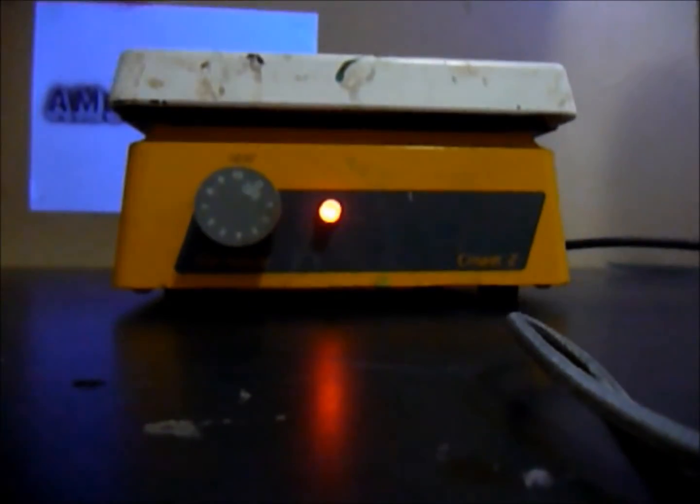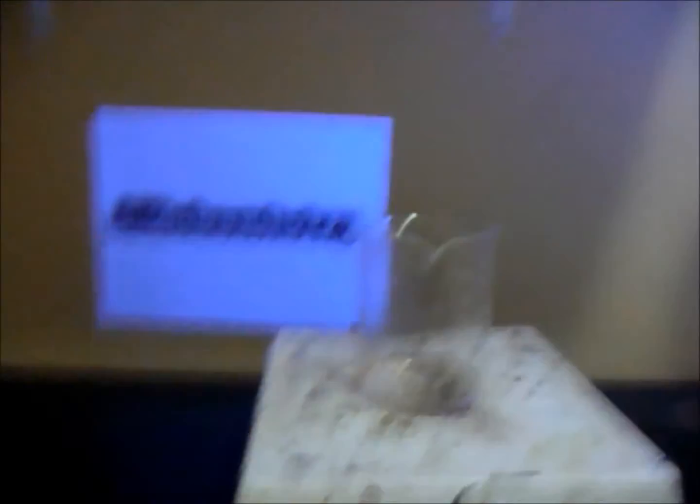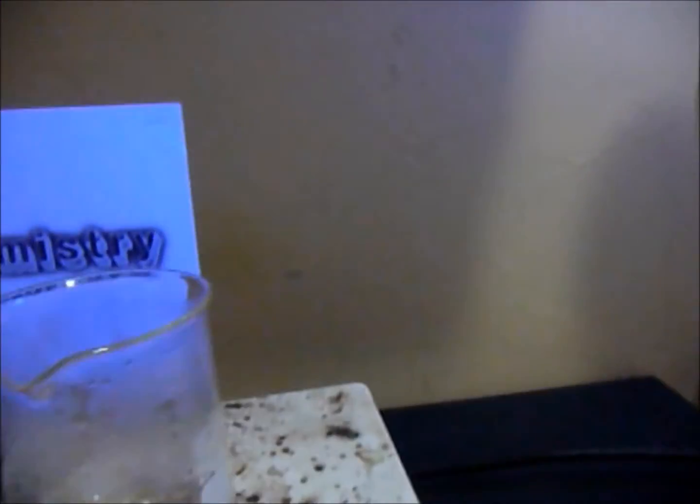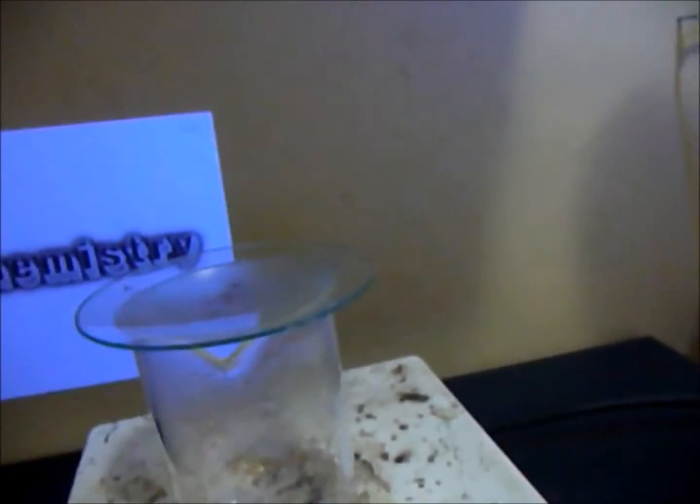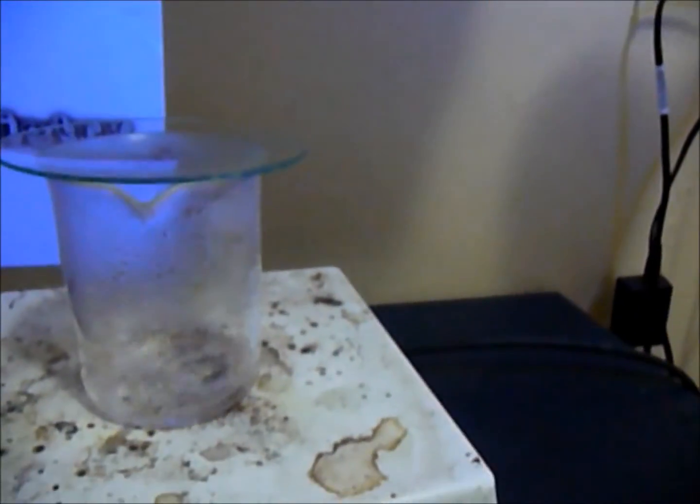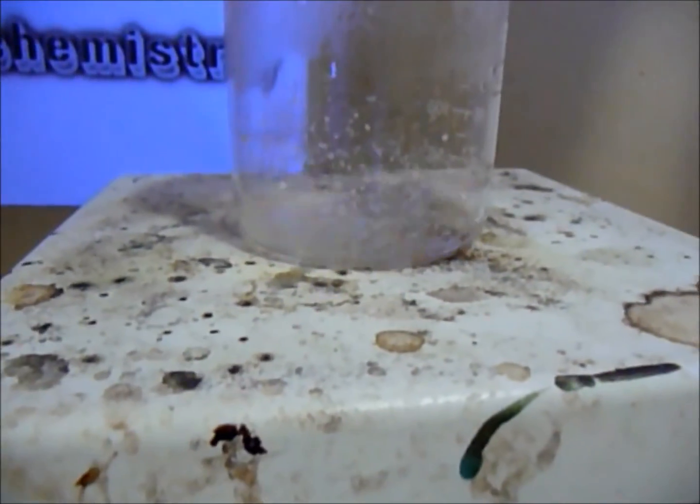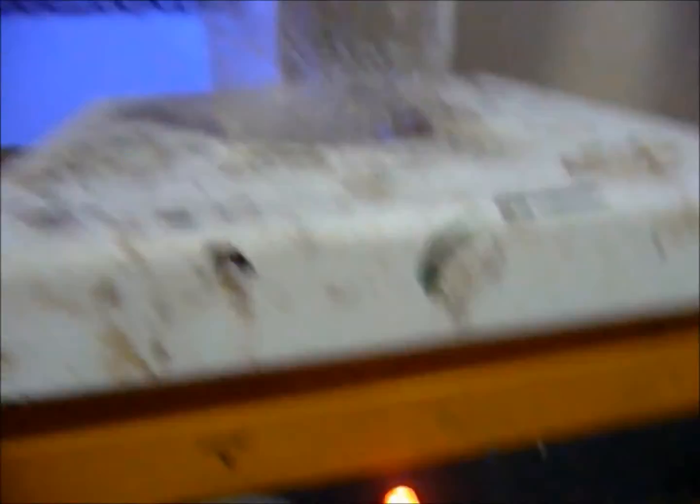Now that it's boiling, a good idea is to put a watch glass over the beaker because a lot of zinc sulfate is being splashed out. So I'll show you when it's finished and it's all to a powder.